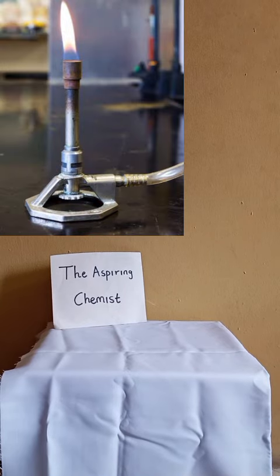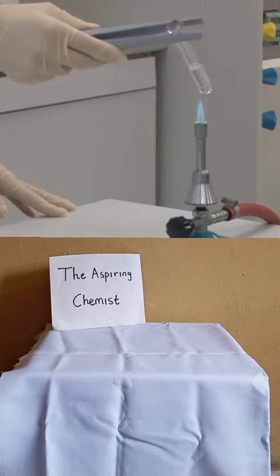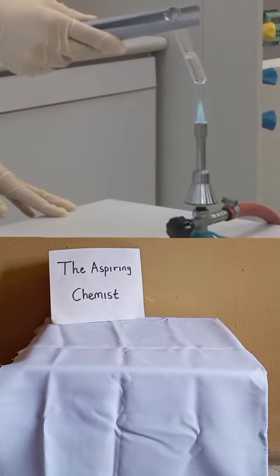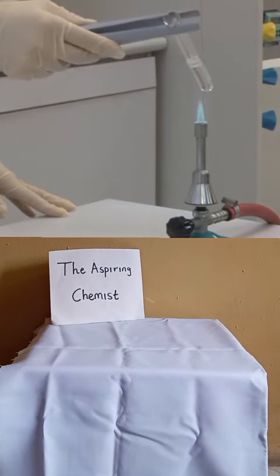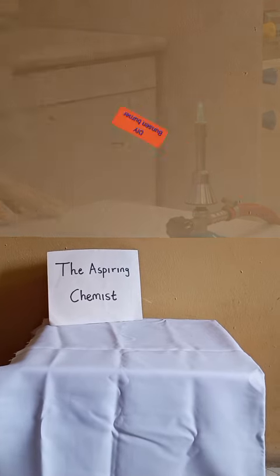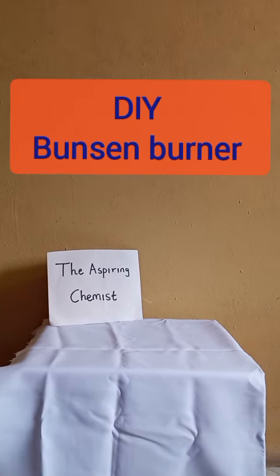If you're interested in chemistry and you're watching this video, you know that a Bunsen burner is important for chemical reactions. For some of us, a Bunsen burner will be easy to obtain, and for the rest of us, it may be hard to obtain due to limited resources. So in this video, I'm going to teach you how you can make a homemade Bunsen burner with household materials.